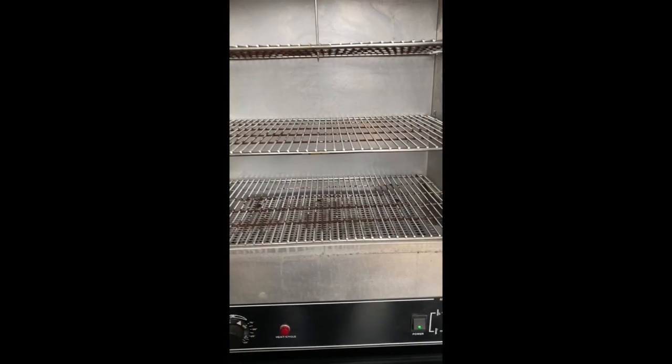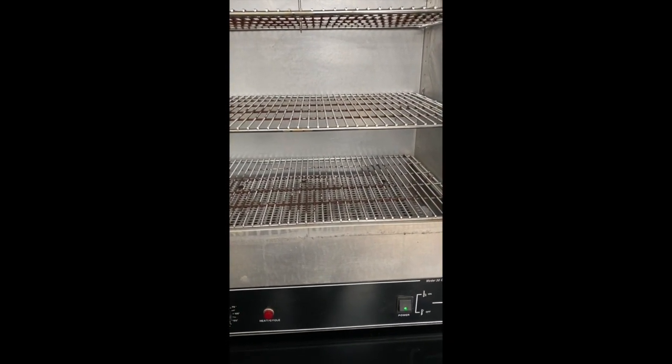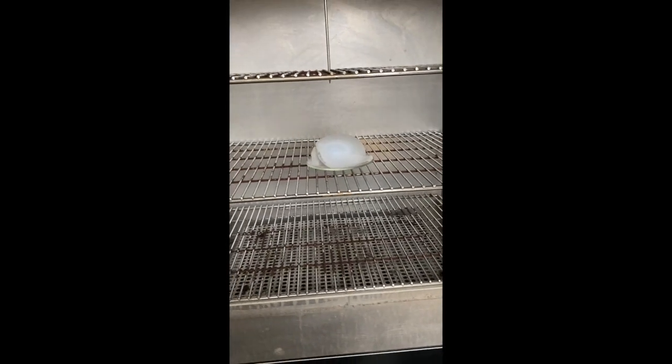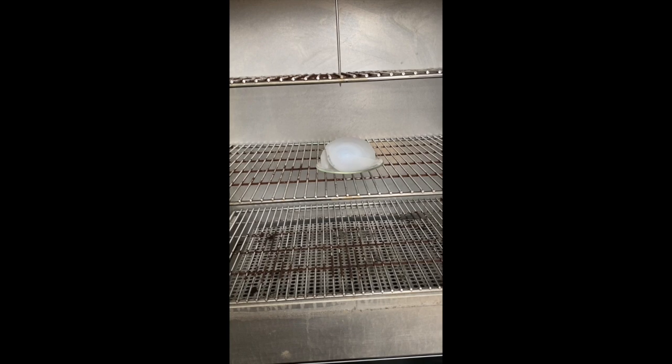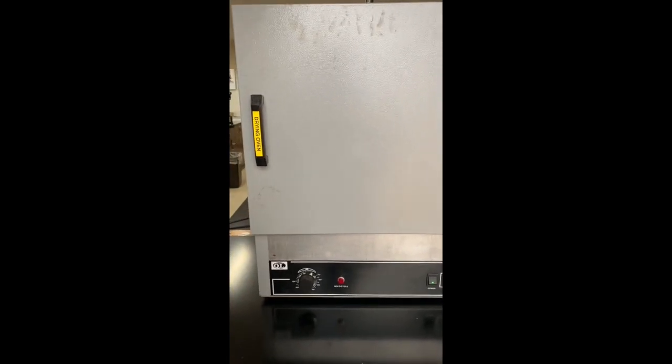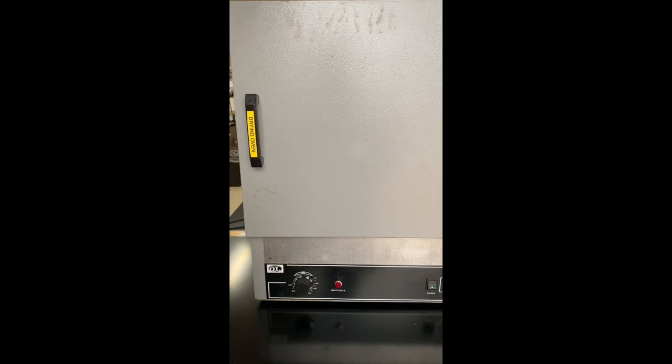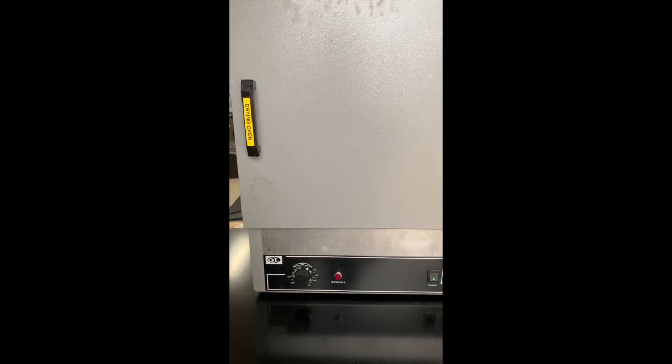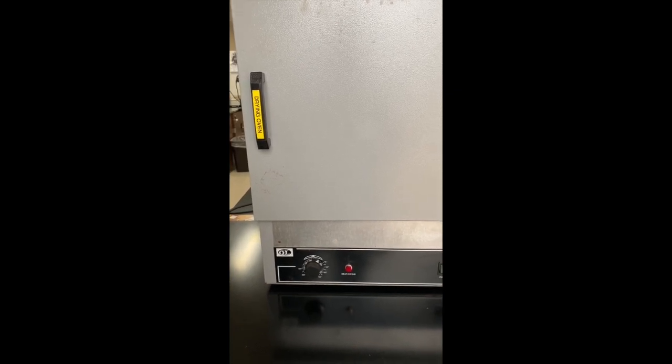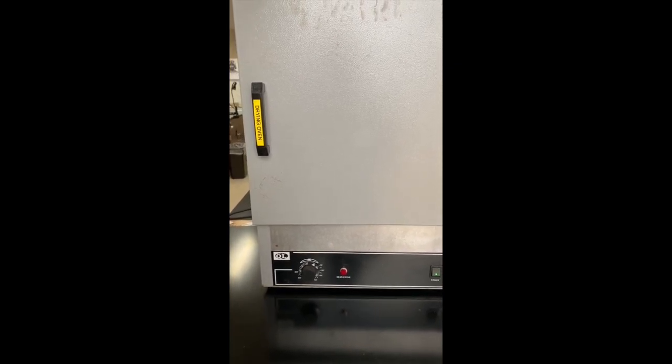Alright, so here is our drying oven. It's been on so that it has heated up. I'm going to place our precipitate filter paper on watch glass in the drying oven. I'm going to close the drying oven, make sure it catches. And we're going to let that dry for 30 minutes to an hour or so. Don't want the paper to burn, but we do want to make sure that it is fully dry before we re-weigh the filter paper and precipitate that we made.